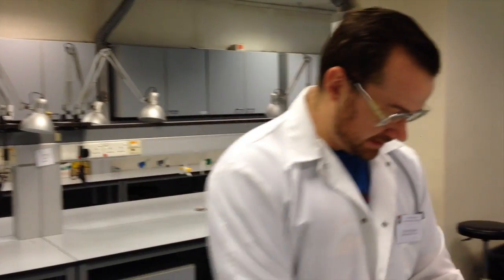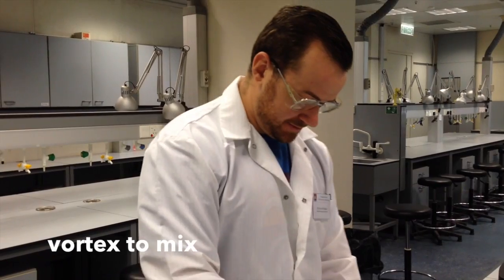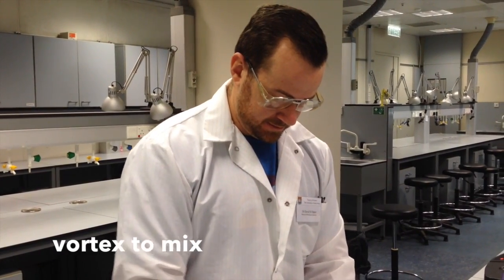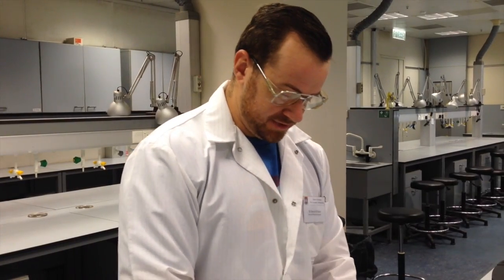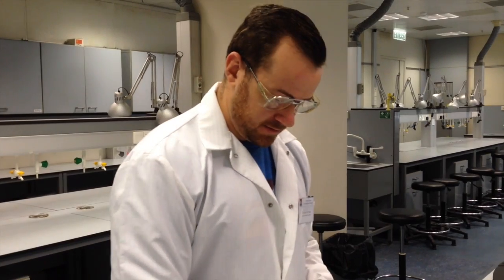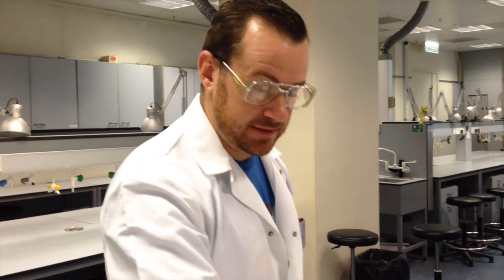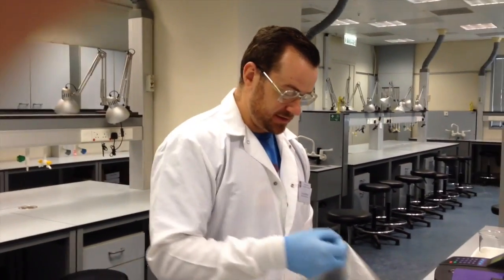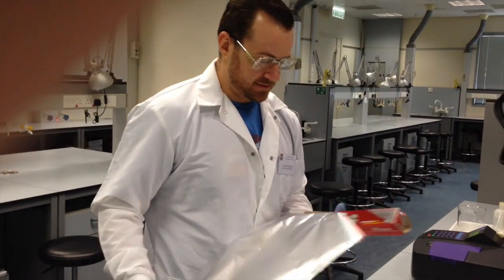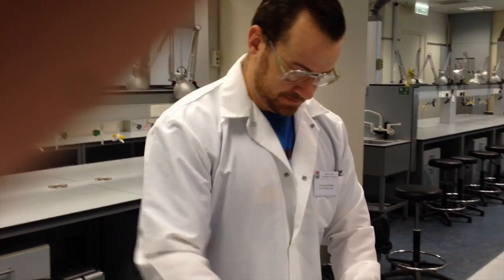And once again, for the last time, I will put the cap on and I will vortex the sample. But this time, once I'm finished, I'm going to cover all of my tubes, the entire rack if I'd like, with some aluminum foil to protect the samples from light. Because light can alter the reaction and it can impact the color change that we see in our sample.